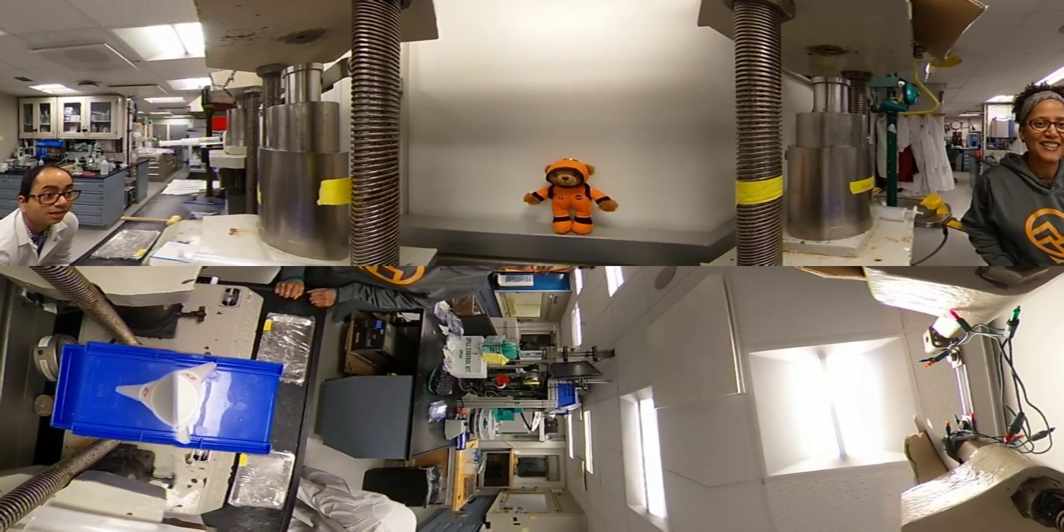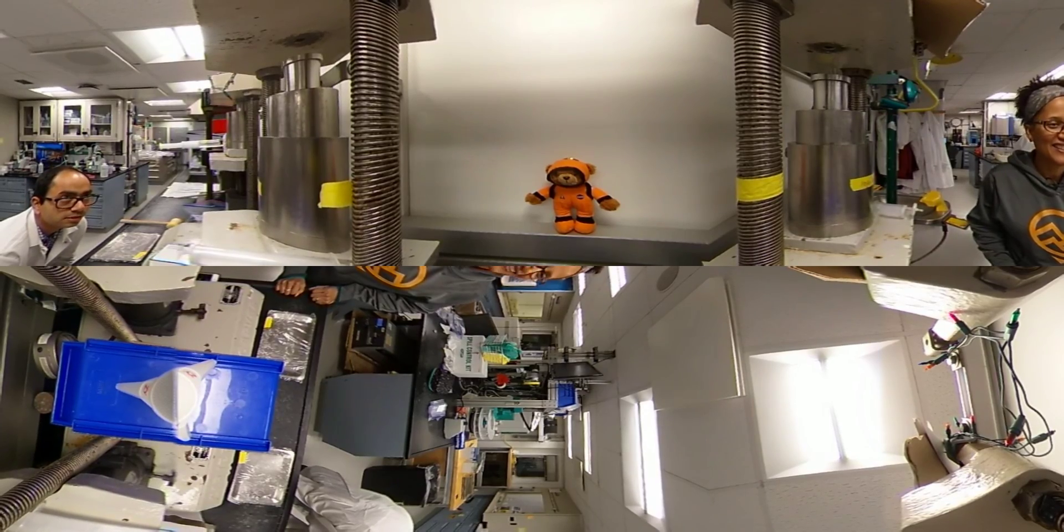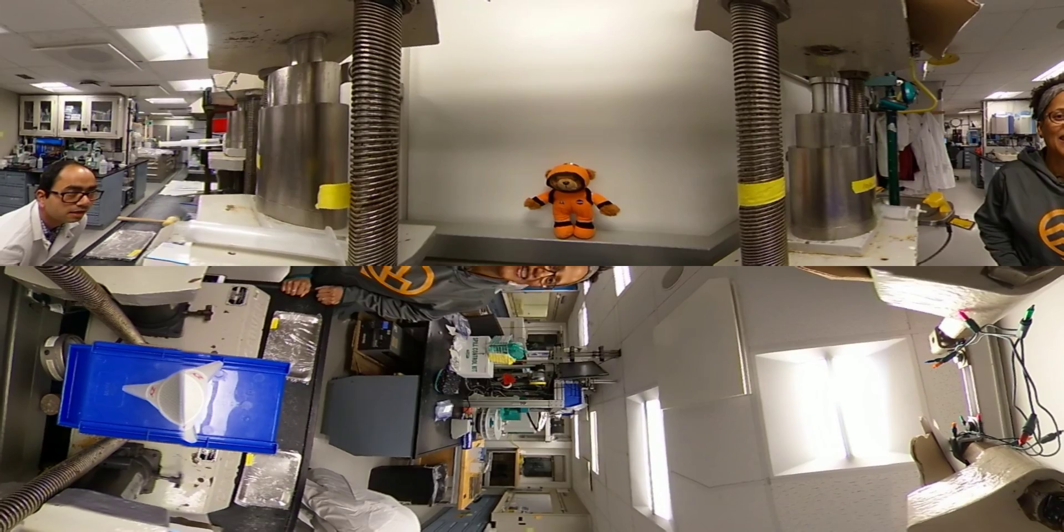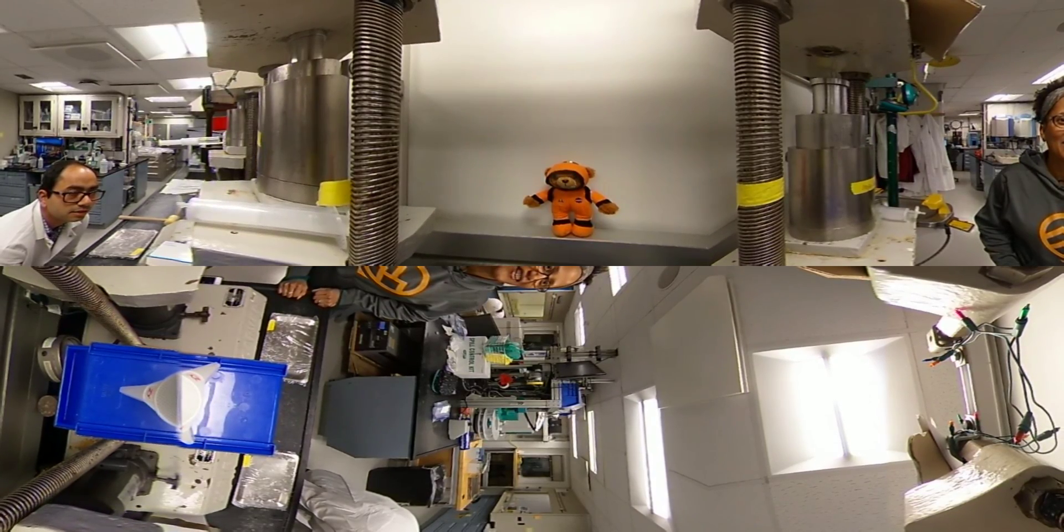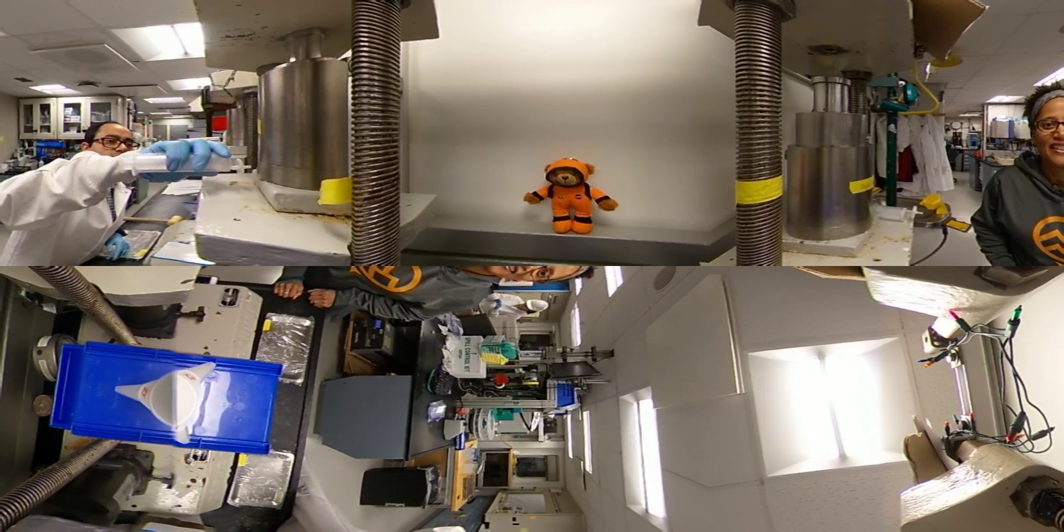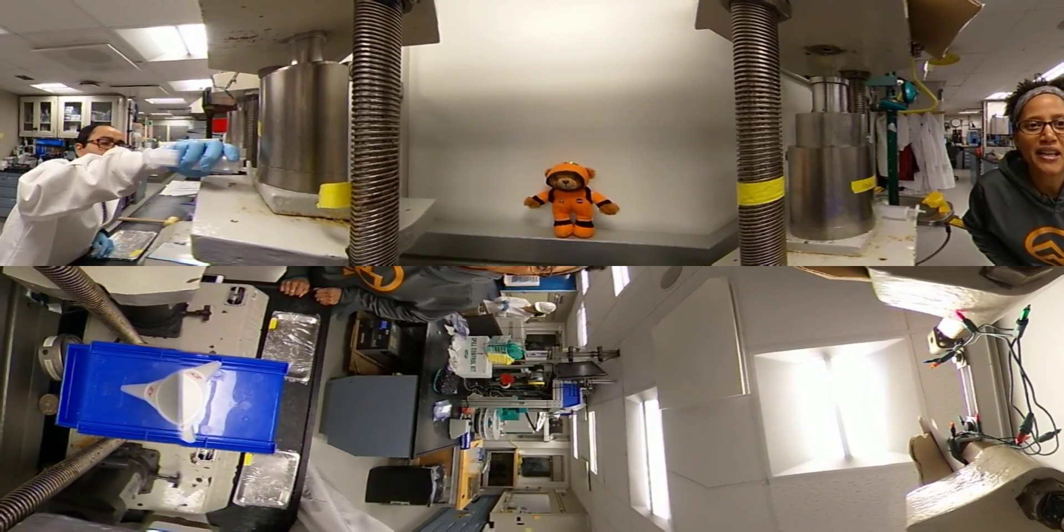Just watch out, so here we put the container up. Here we go. Oh wow, that comes out really fast.